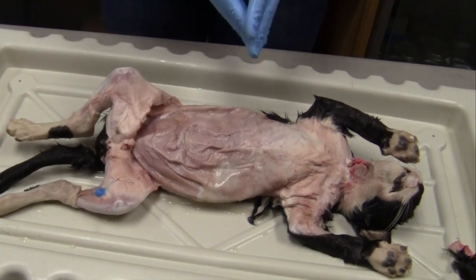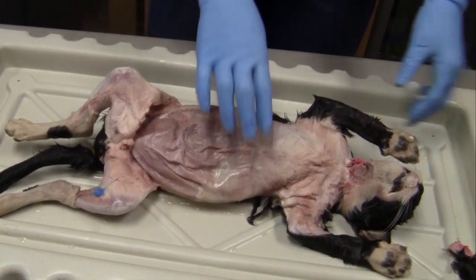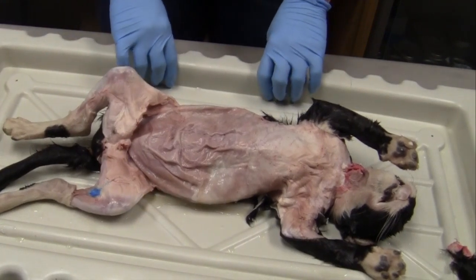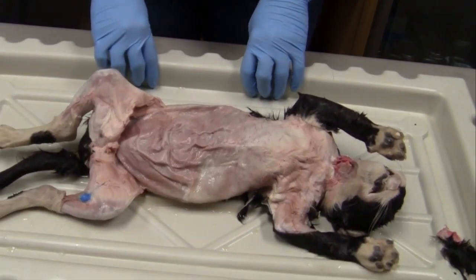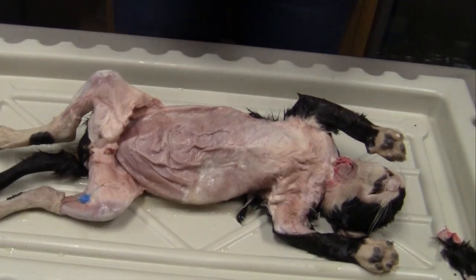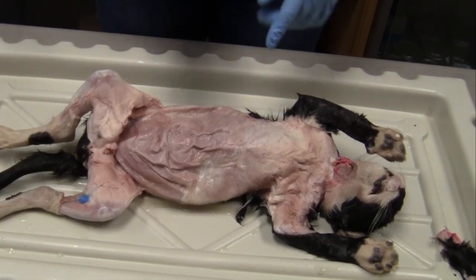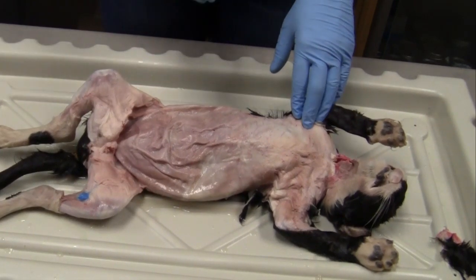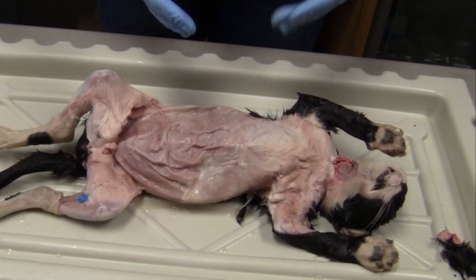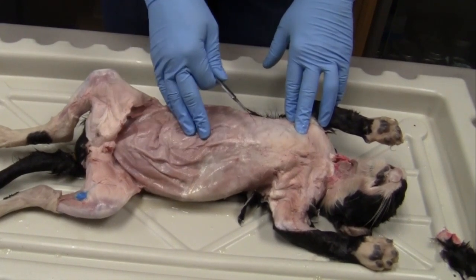Okay, so we are moving on to the actual dissection of our cats. First of all, hopefully you can see this a little better. When you're actually dissecting the cat in lab, I suggest that you go ahead and play this video. It's going to be posted on Canvas. Hopefully you will play this video during lab, and it will help you get through the dissection of your cat.